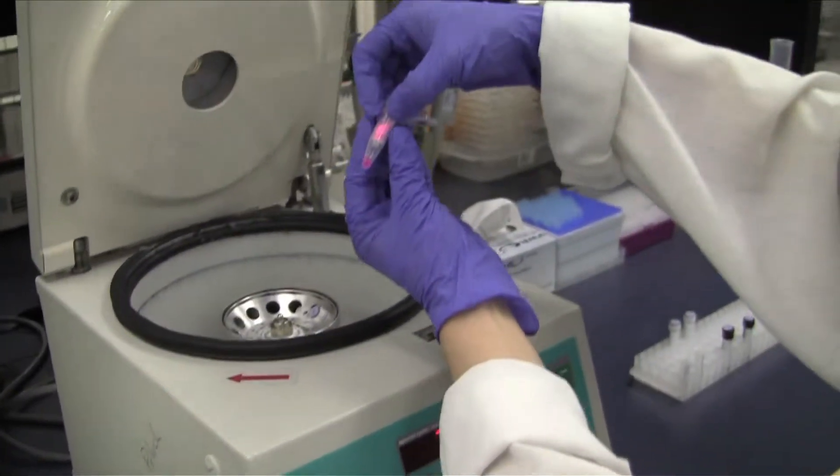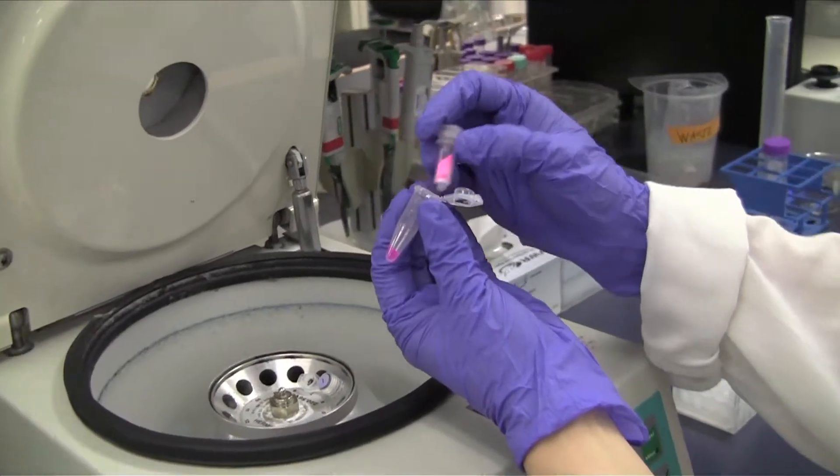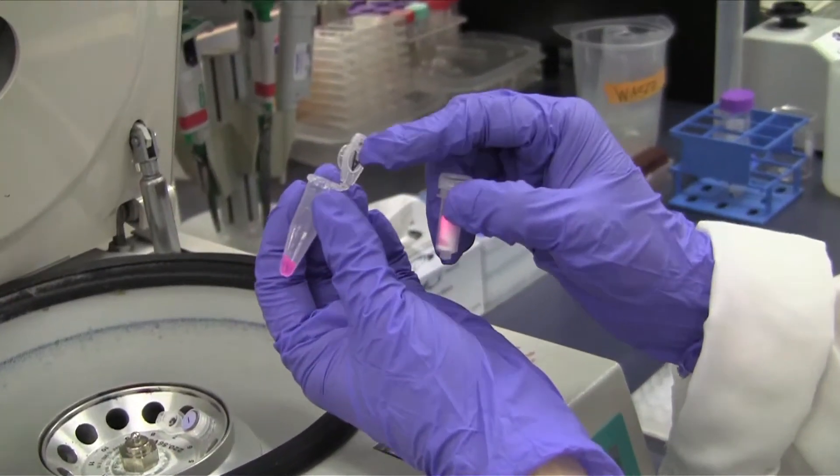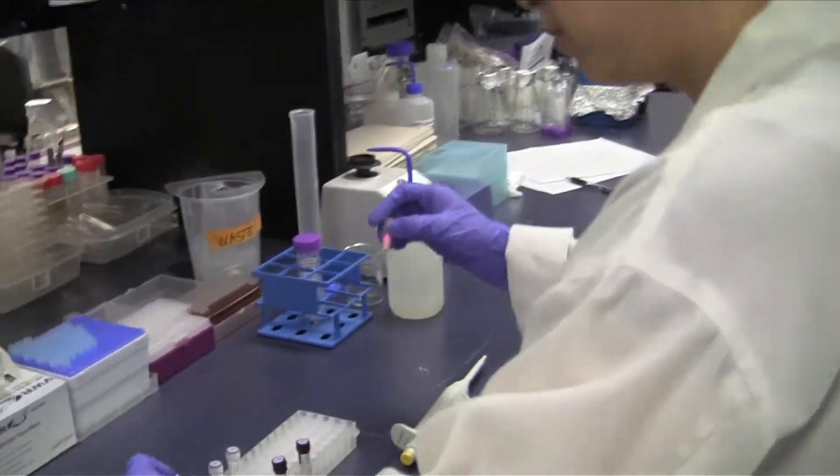Purified samples can be stored at minus 70 degrees Celsius or below if the probing is not to be done on the same day. The columns can be discarded.